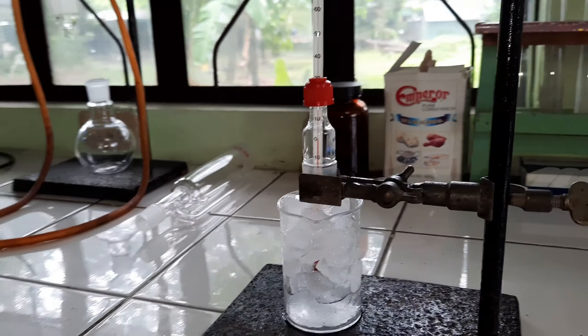There we go. Try to note what will happen to the temperature reading as frozen water in the form of ice gets mixed with solute particles. In this case, we are using sodium chloride. I will add in more sodium chloride crystals into this mixture.